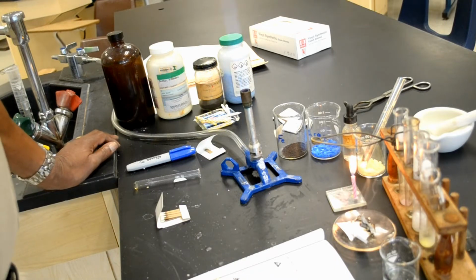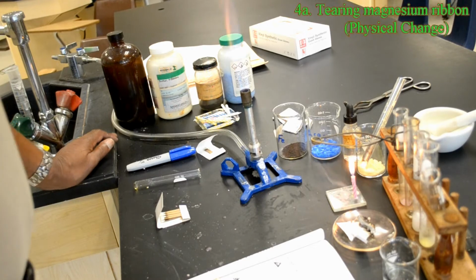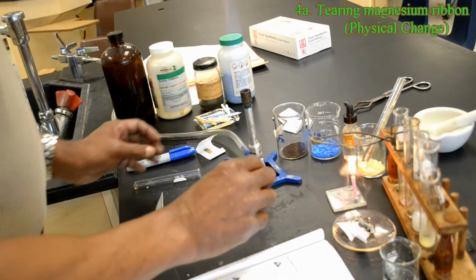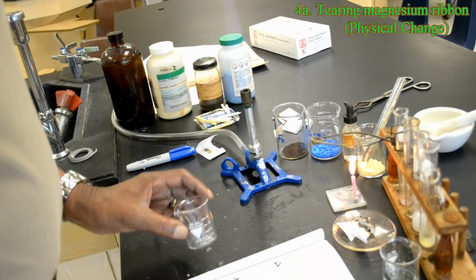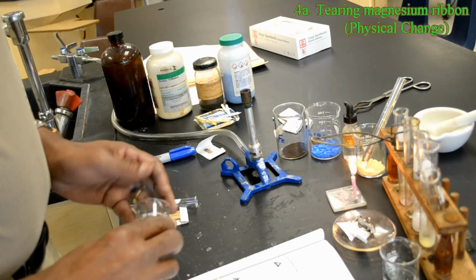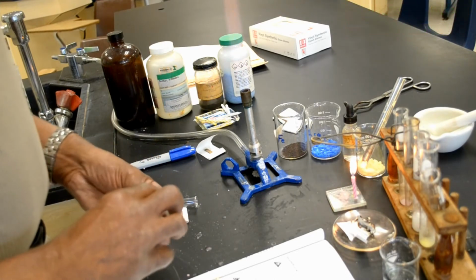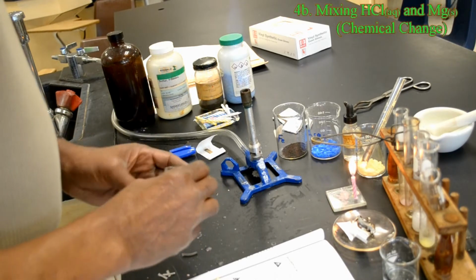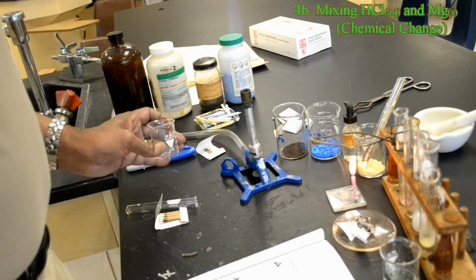Obtain a piece of magnesium ribbon. This is number 4. Obtain a piece of magnesium ribbon about 5 centimeters long and tear it into 1 centimeter pieces. Place 2 of the pieces into a test tube and add a few drops of 6 molar HCl.